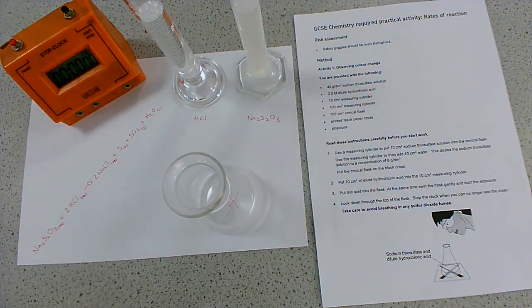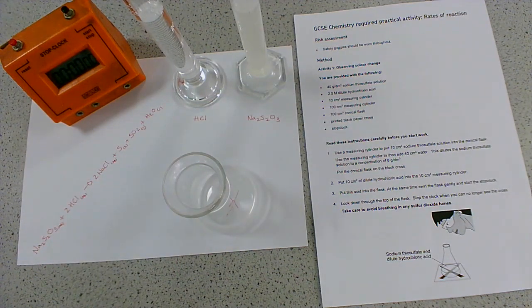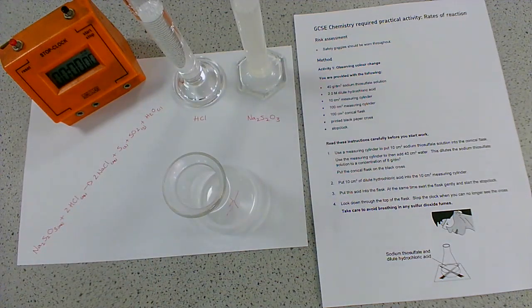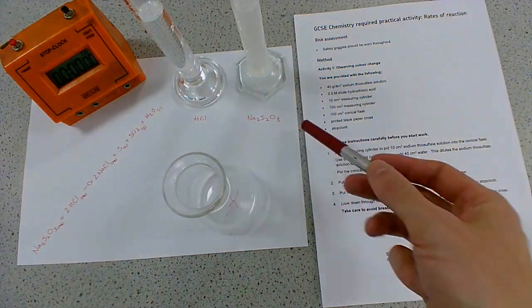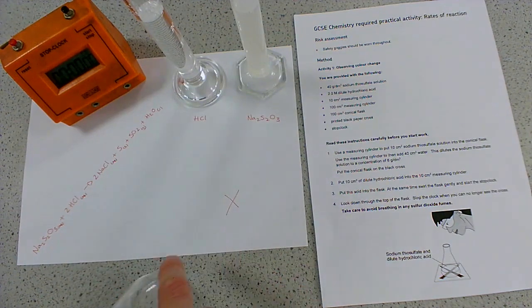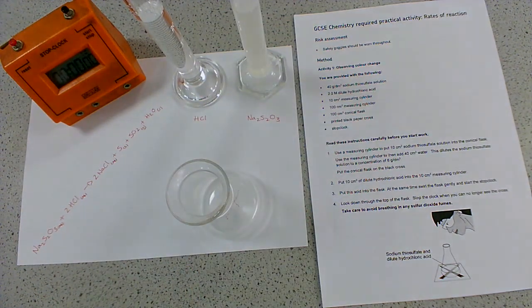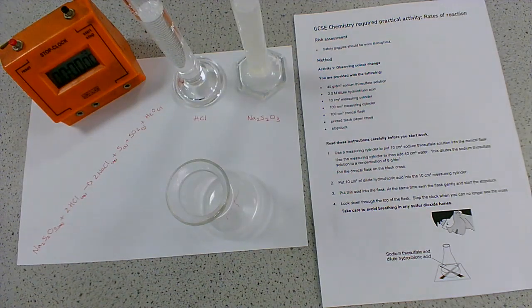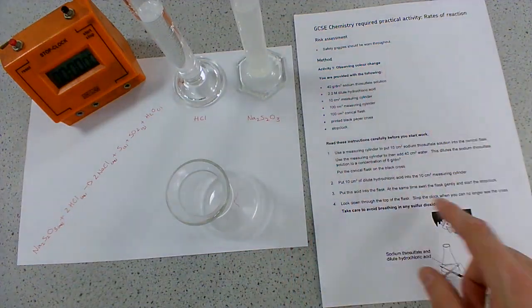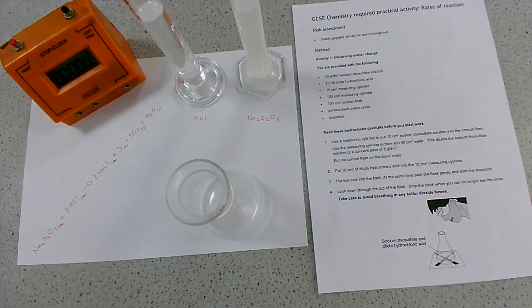It's going to go from an aqueous solution to a very cloudy, sort of yellow colour because the sulfur is insoluble. All we do is add the hydrochloric acid and the sodium thiosulfate together, and we time how long it takes until we can't see the cross anymore that's been put on the paper. It's very low tech but very effective. Any time you see this diagram setup, this should set off alarm bells - this is the disappearing cross reaction.